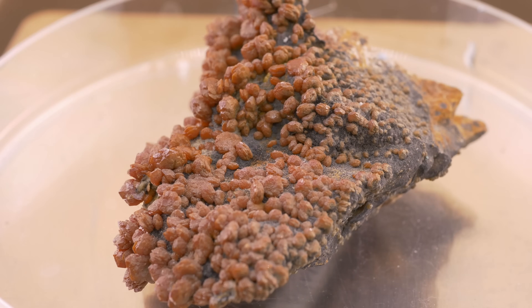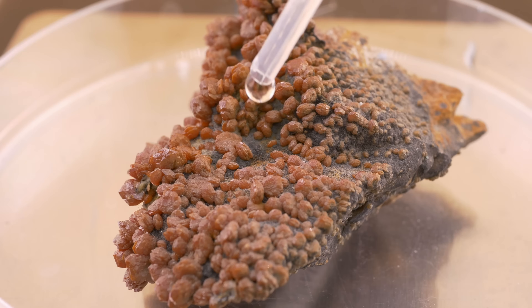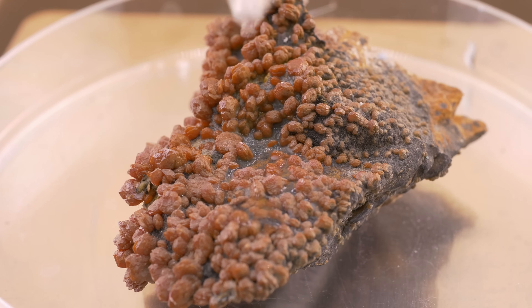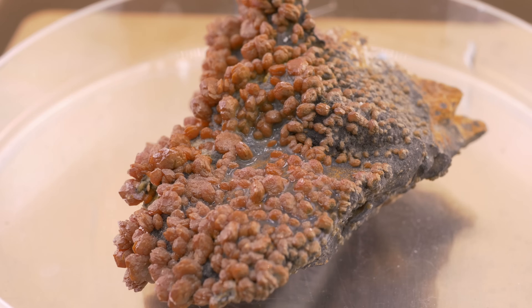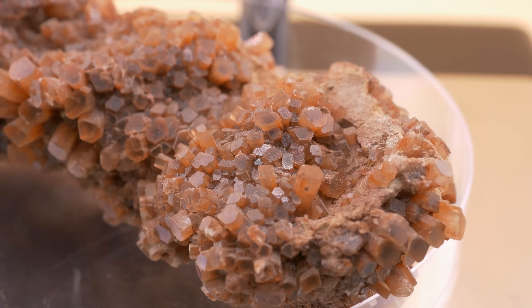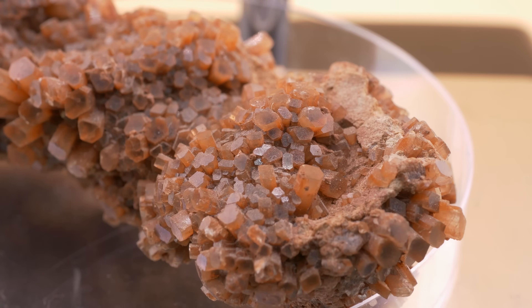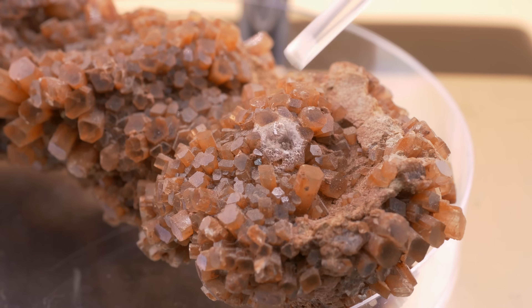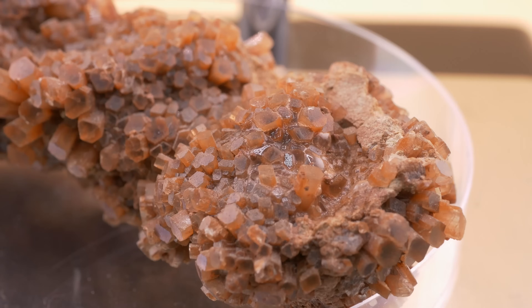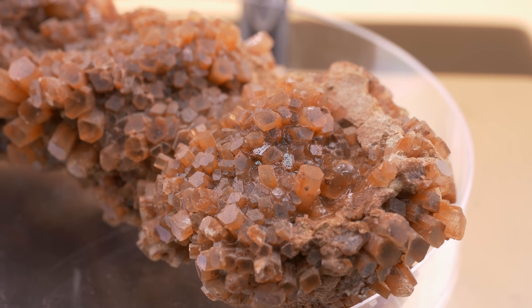Now this piece was labeled vanadinite and was actually used in the vanadinite video. Let's see what it does. No reaction. So that means this is very likely vanadinite. And here is the piece we actually used in the vanadium video. That's a clear reaction all right. So that means the person who commented on the video was right — this is probably aragonite, or at least a calcium-based mineral.